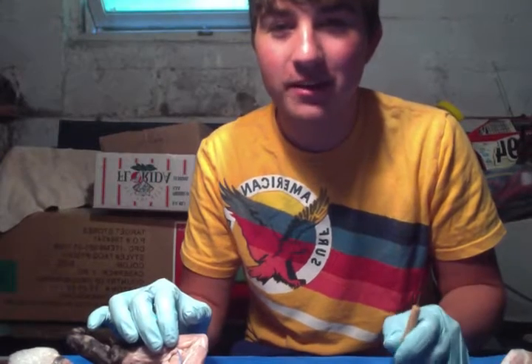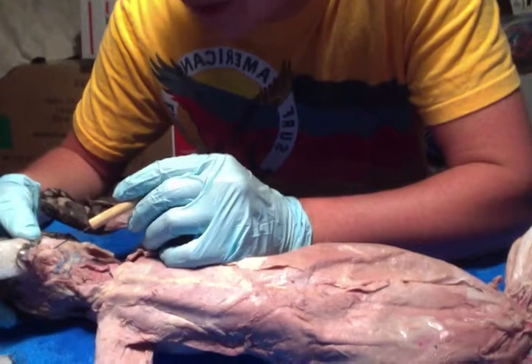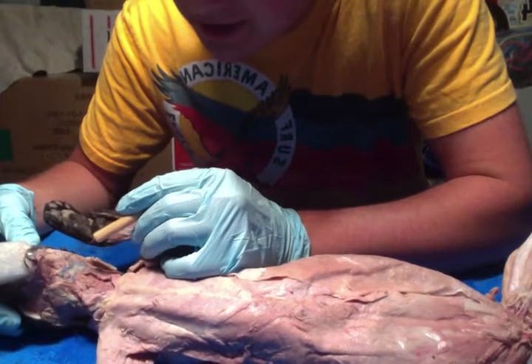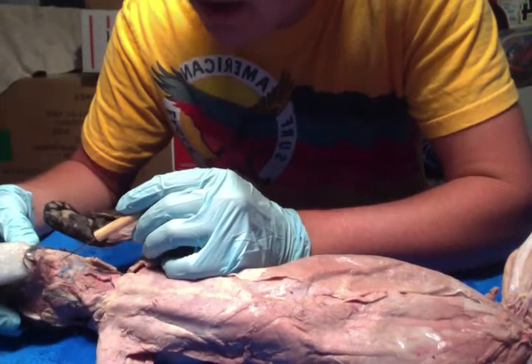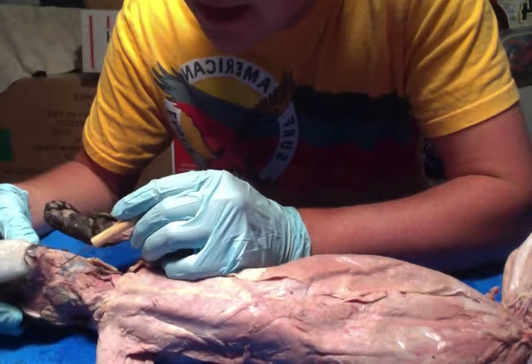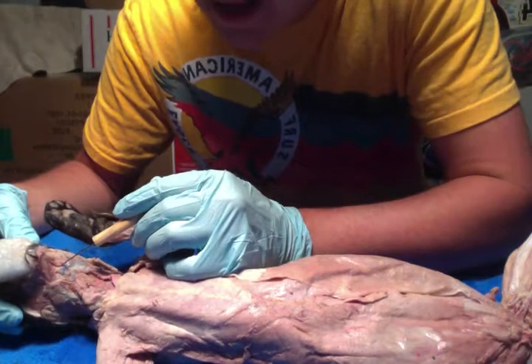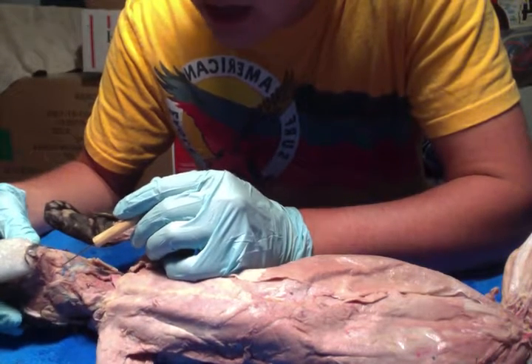This is my video on the muscles and their actions. So right here we have your mandible, which is bone, and then we have your digastric muscles right there, which elevate the hyoid and depress the mandible. Beneath that we have the mylohyoid, which elevates the hyoid and is tongue-based.